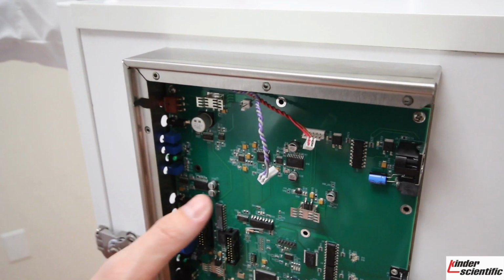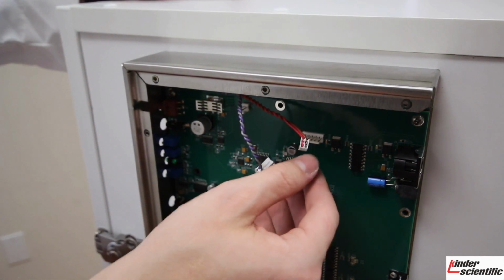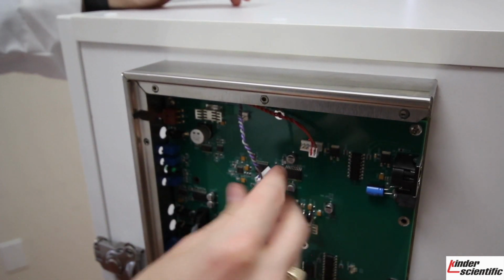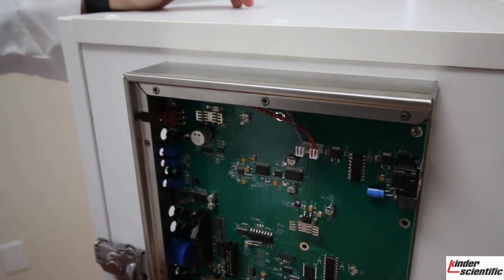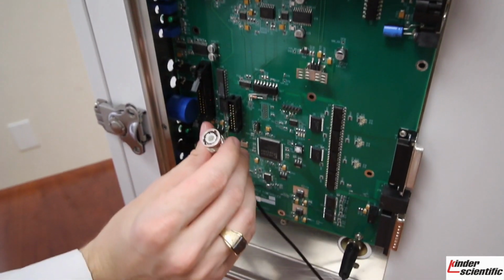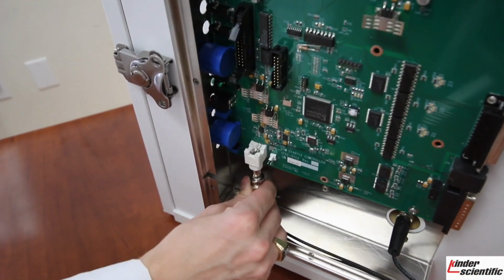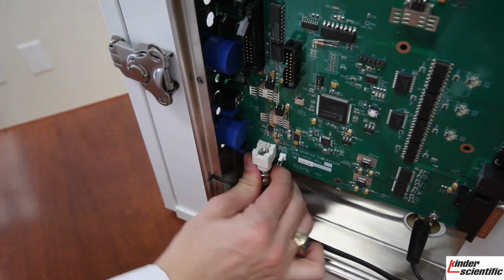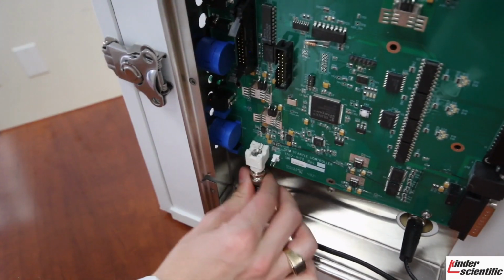Once your board is back on, we're going to reconnect the speaker and the light. If you remember, the light went on the far right, and the speaker was on the far left of the pins. You will then take your BNC cable, and you can see there are these little grooves for the notch to slide right in. So you just go ahead and wiggle that up, and then rotate it, and you will hear a clicking sound to indicate that it is locked and it is secure.